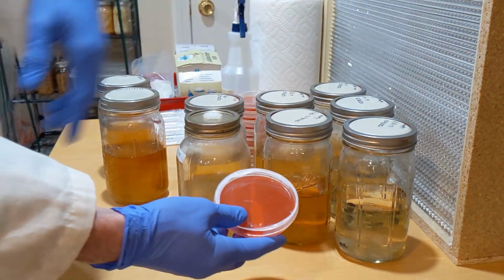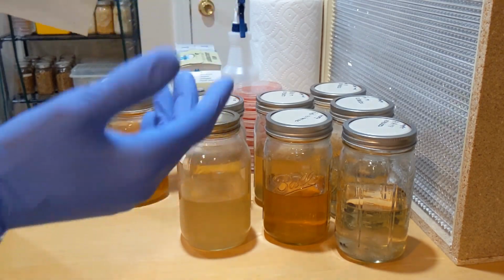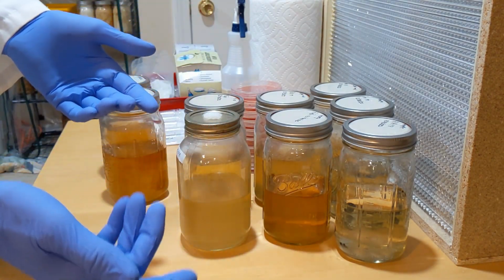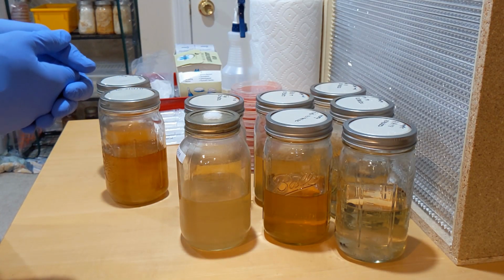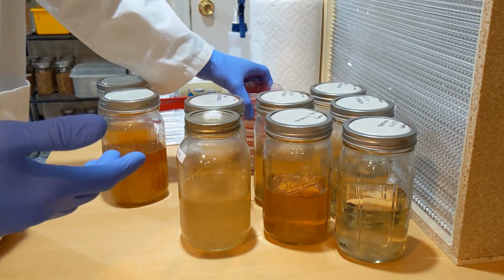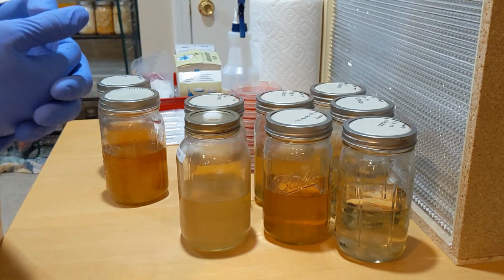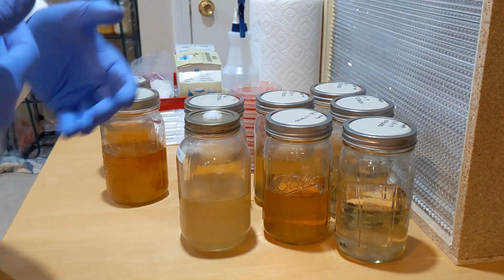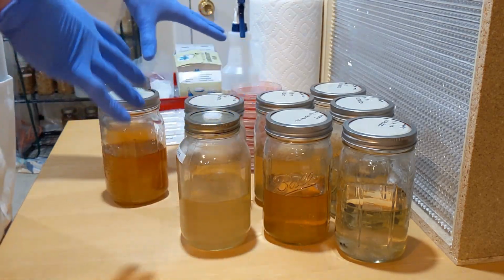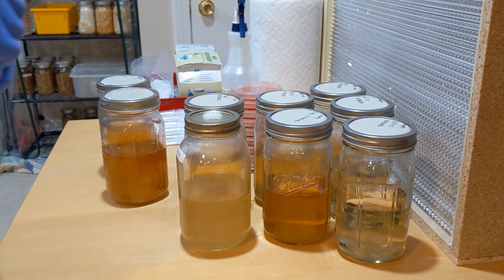We're gonna drop some of that liquid culture on this agar that I made, and we're gonna see the growth over the next week, which I'll make an update about. And we're gonna see which cultures are clean, which are not, which ones have actually grown, and we can take a better look at the mycelium and get a better idea of what the growth is gonna look like. So I'm gonna go ahead and tidy up over here, and I'll catch you guys in just a little bit.